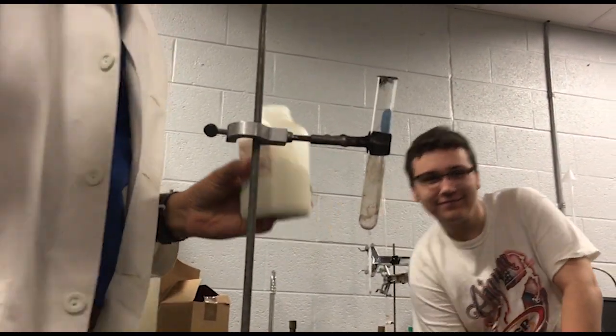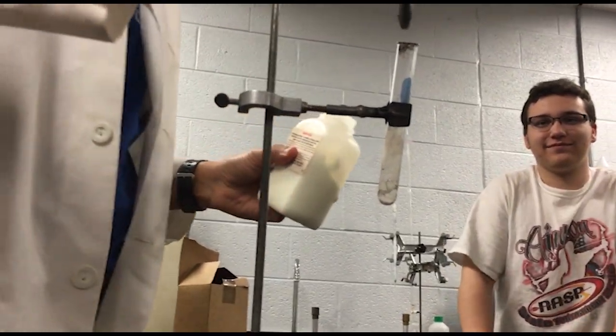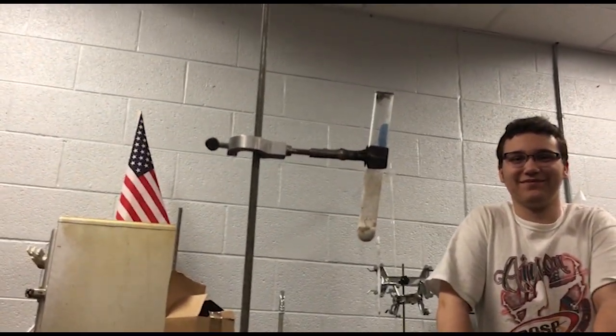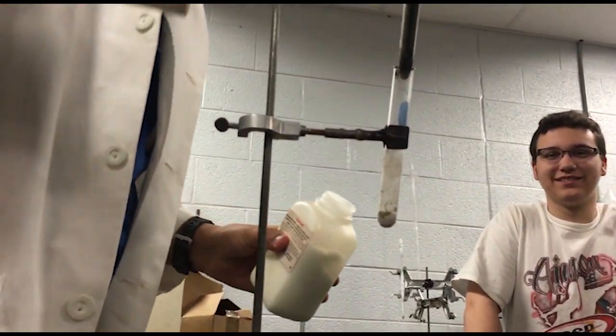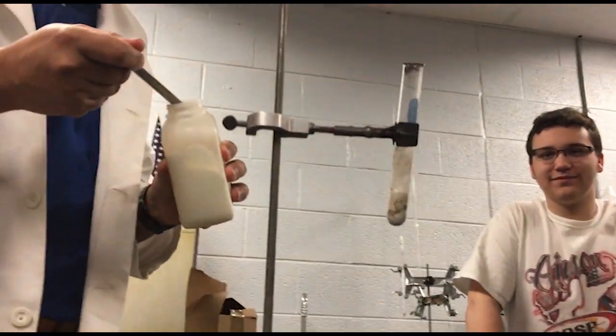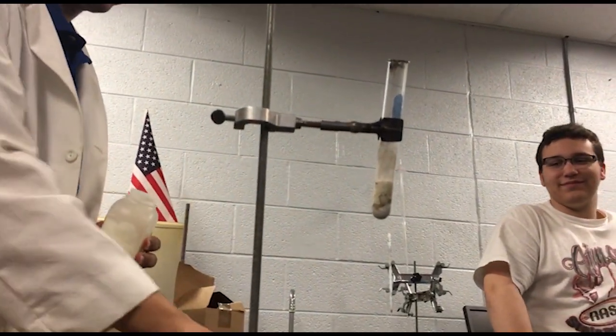and put that into the test tube. I think I need more than that. I want to have a lot so I can have a big explosion. Okay. Don't worry. I'll be fine. I want to go to the hospital anyway. Okay. Screw the lab rules. All right, a little bit more. Okay. This is going to be fun.